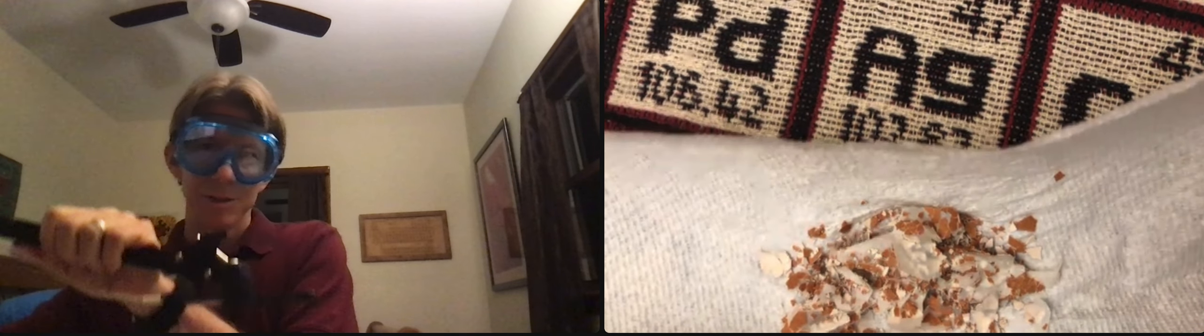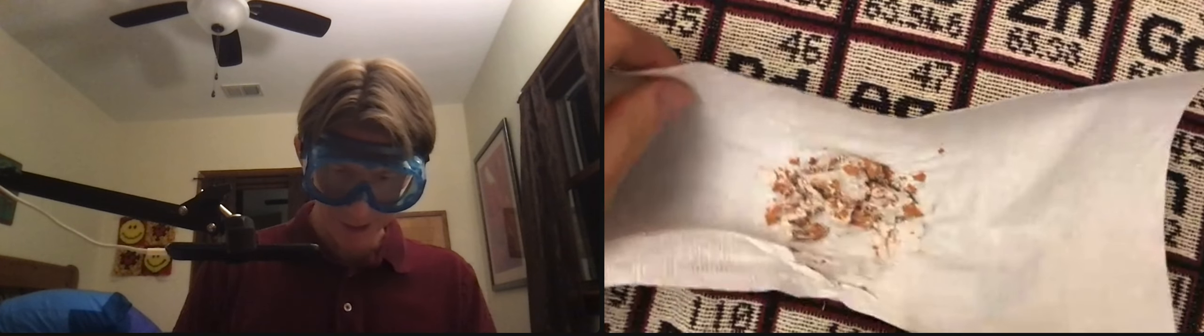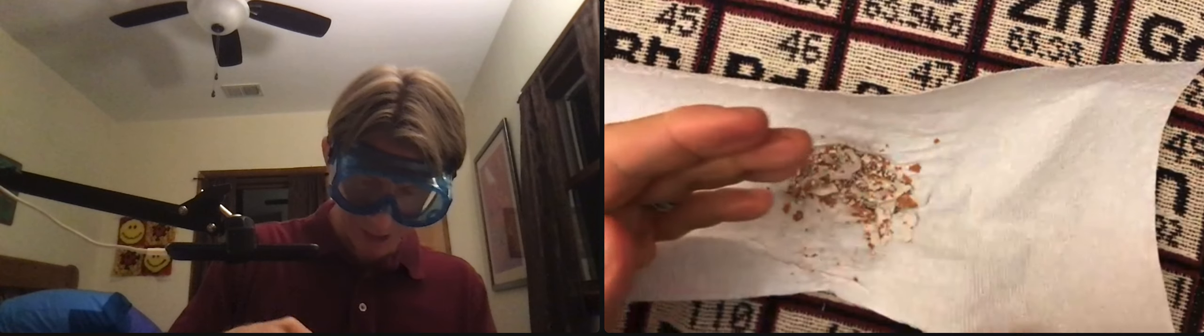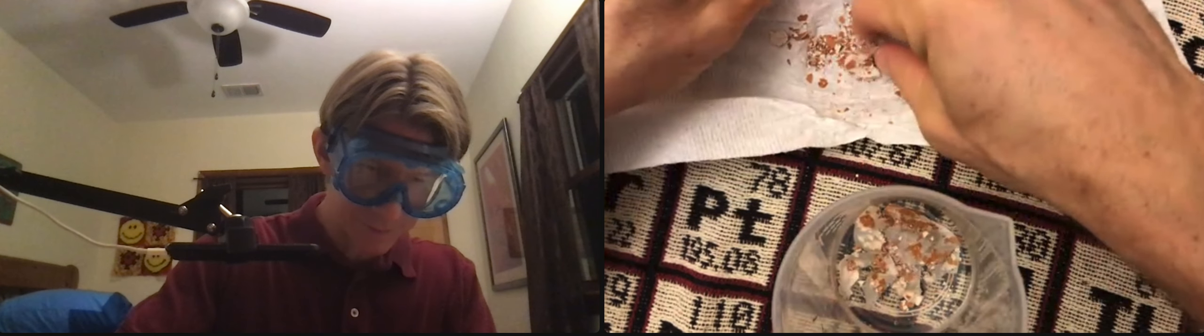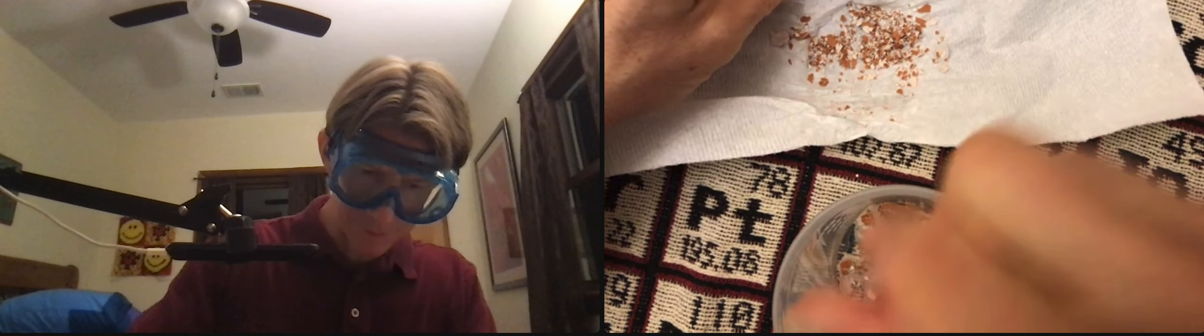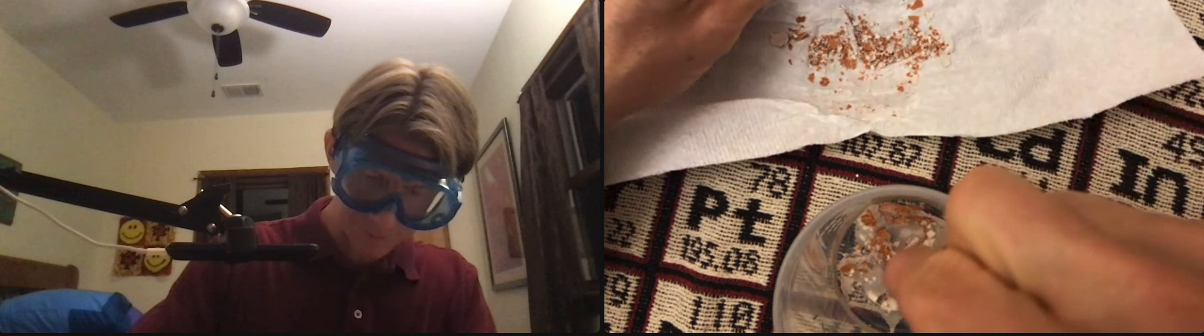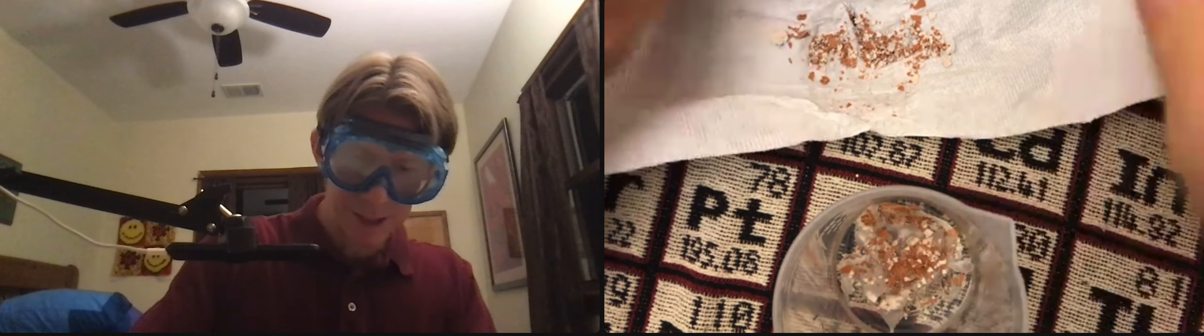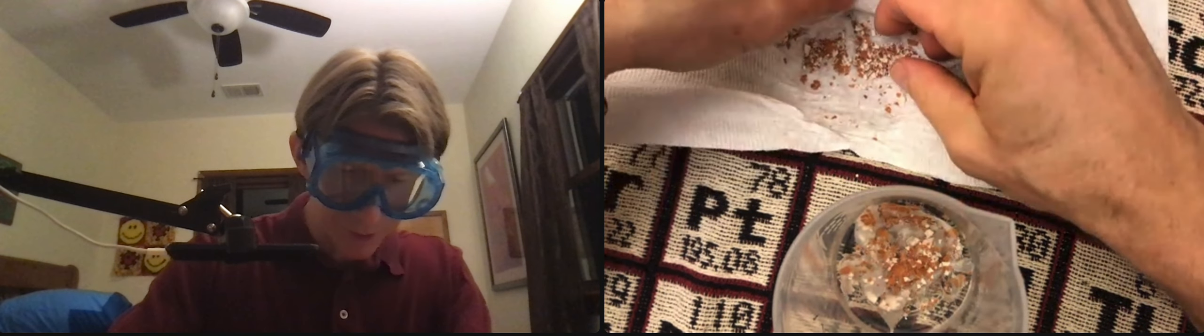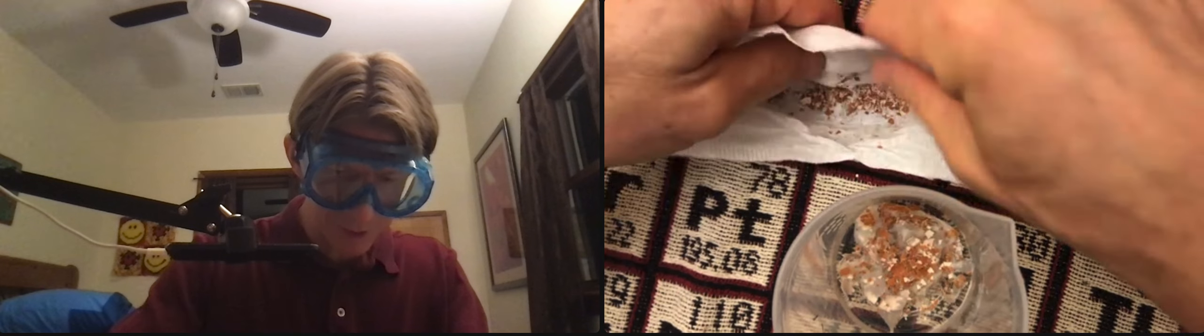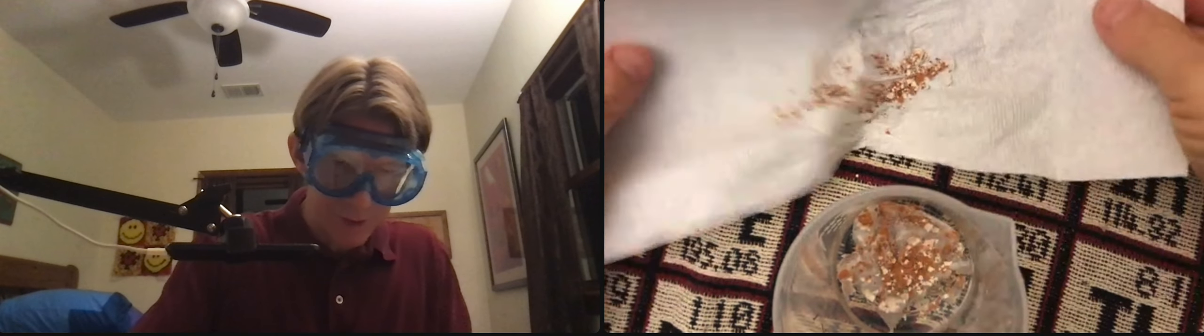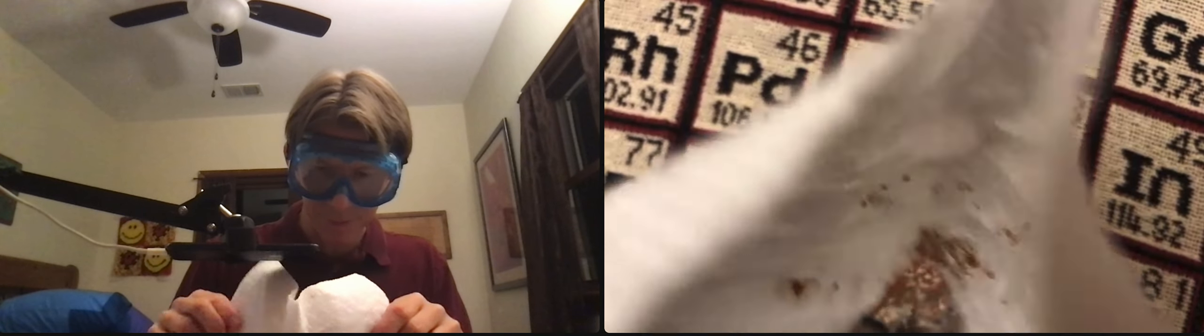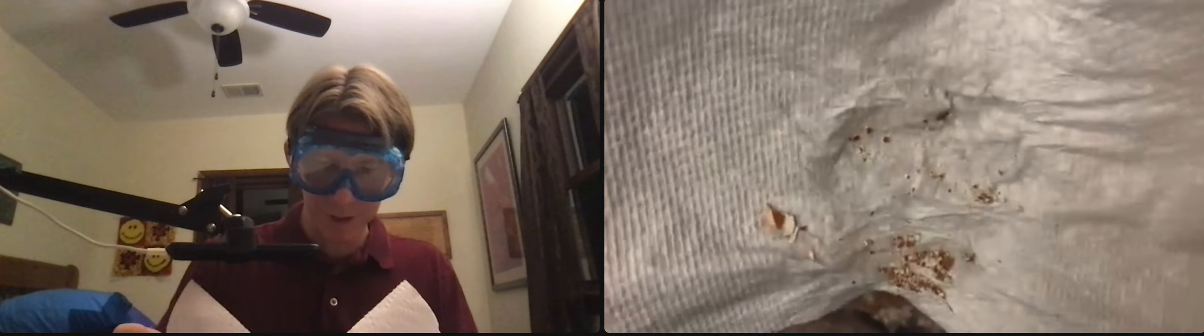I do have a small hole there, so I'm going to try and get all the pieces away from that. I wonder if I can just sort of pour it in. There's a big piece there - I might even crunch that up a little more.